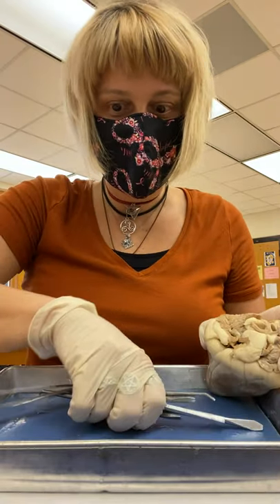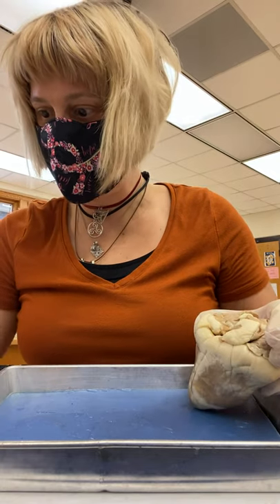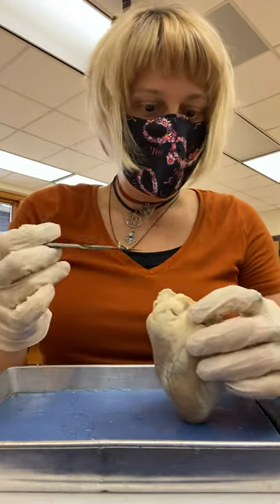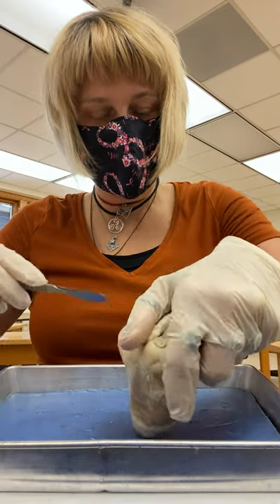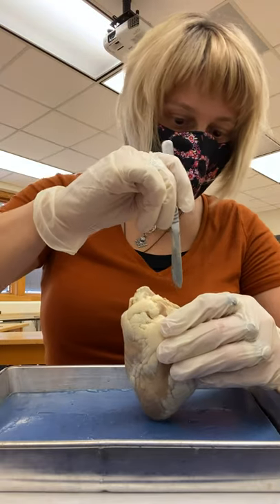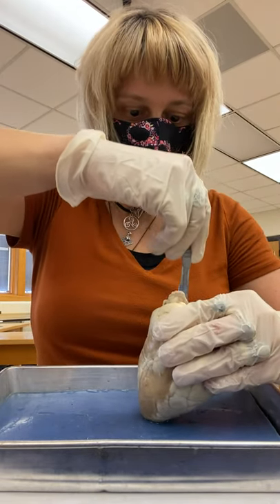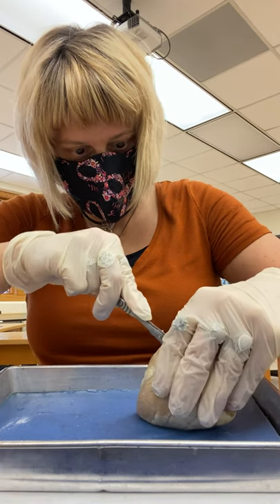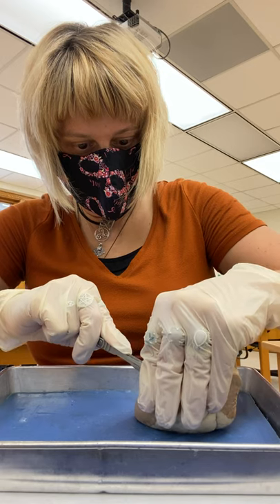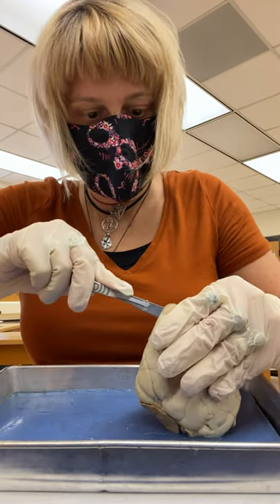Now let's start the dissection. We will start by using a number 15 blade, starting from dead center superior, working all the way down to the apex on both sides. We're going to cut the heart equally in half. I usually do the saw method, just kind of cut through the material. Follow the line — you never want to do a new line. You want a nice, neat incision.